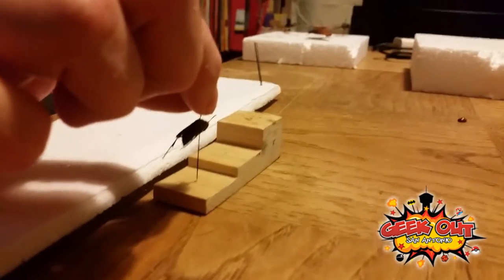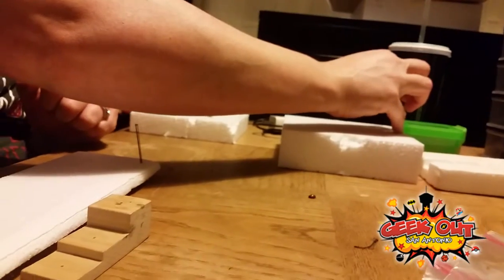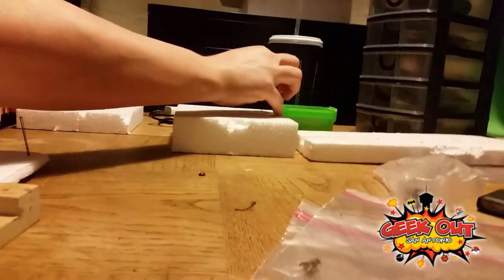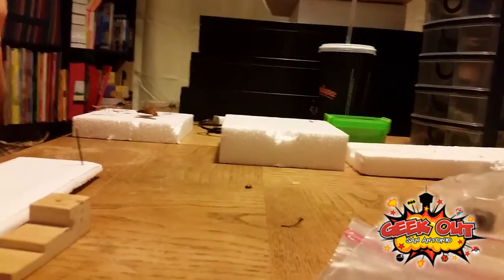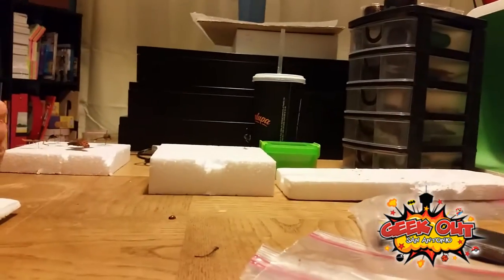The other parts of the stage would be for when you have your labels — you need two labels total. This is another piece of styrofoam I'm going to use for what I call the staging area, where you're kind of putting them together before mounting.